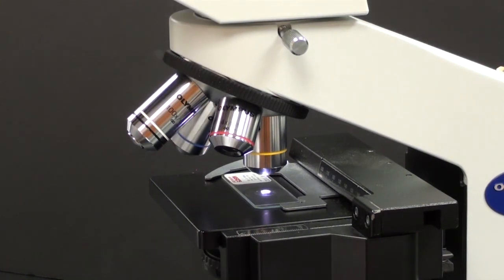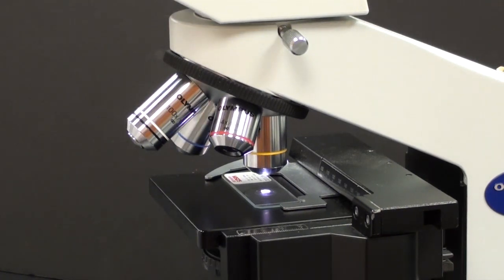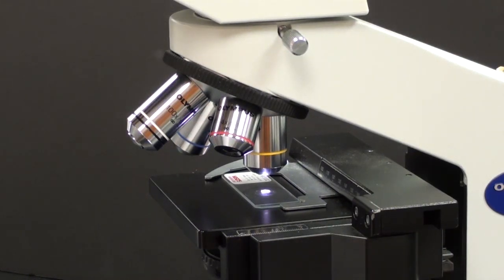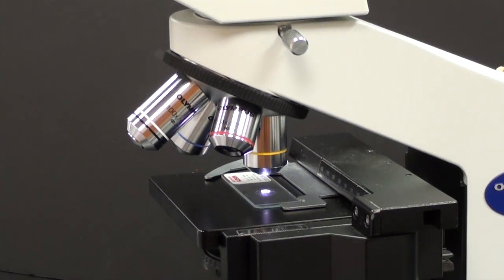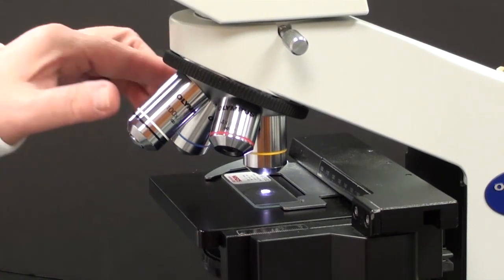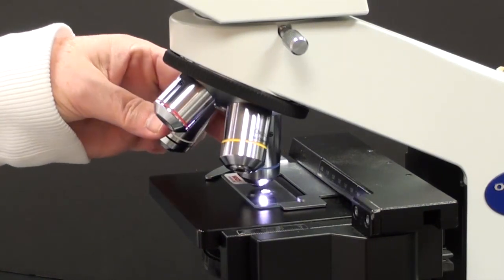What you're looking at needs to be focused, but only with the fine focus knob. Again, you need to take the time to make sure what you're interested in is in the center of the field of view. I've taken that 2 or 3 seconds to center the egg that I'm interested in in this slide of a cat ovary. And I've fine focused. Now I can switch to the next lens.